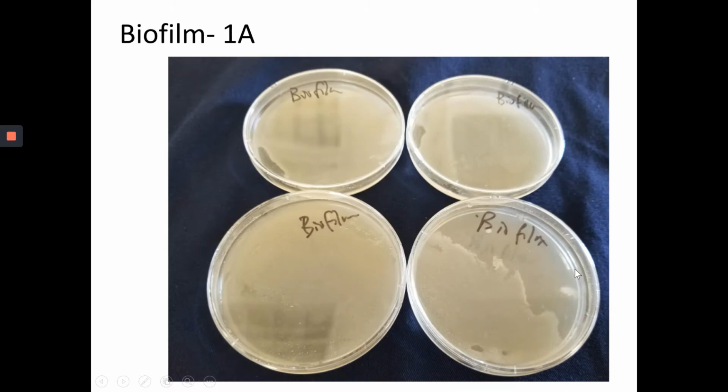The reasons could be many. For example, not enough bacteria volume, or perhaps the plate was tilted on one side when placing the disc, so there's an uneven spread of the bacterial solution. That's another reason why we recommend students do 1B rather than 1A. After 24 hours you may discover you can only use half a plate, and that may affect your plan.